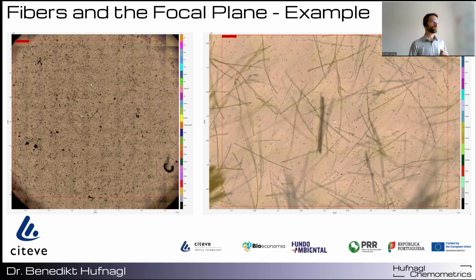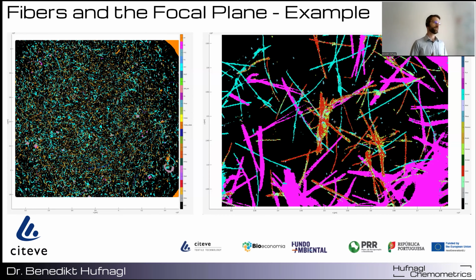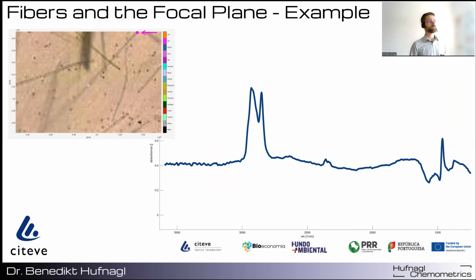So here you have a wastewater treatment plant sample from a textile plant. And on the right-hand side, you have a textile washing sample. What we want to do is recognize all the fibers in these samples. And of course, many of them will not be within the focal plane. Here we will take a closer look at how this looks. So we will look at this fiber here. You can see in the microscope image that on top, we have a nice focus on the fiber, and here it gets really diffuse. And again, we will sample across the fiber.